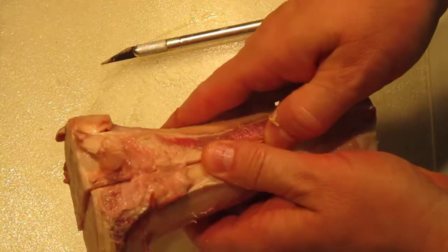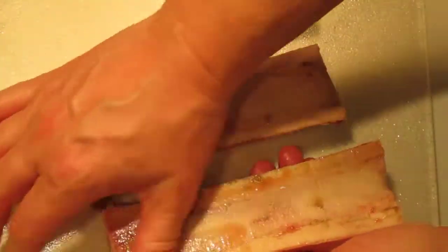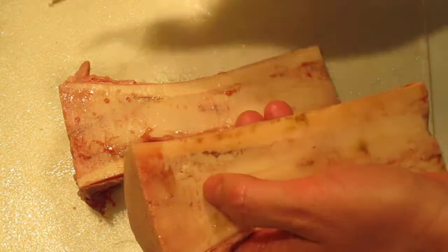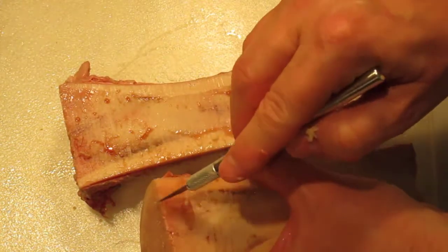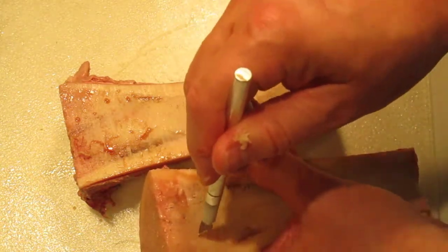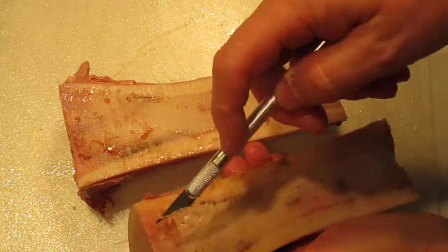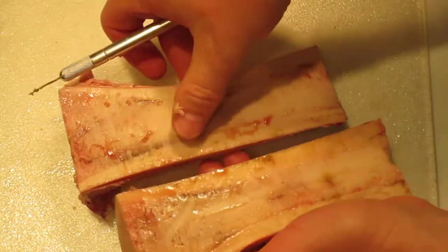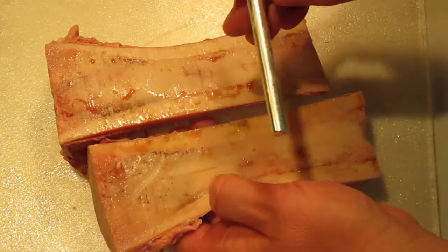If we pull the bones apart at the seam where it was cut, we can see inside. Here's the spongy bone up here, and as we go down it gets softer — this is all yellow marrow. The red marrow is up here at the epiphysis end — that's where some of this blood comes from — and this is all yellow marrow in the diaphysis region.